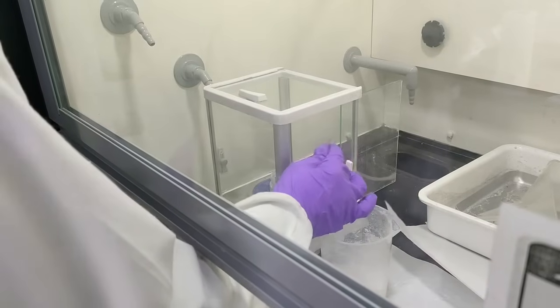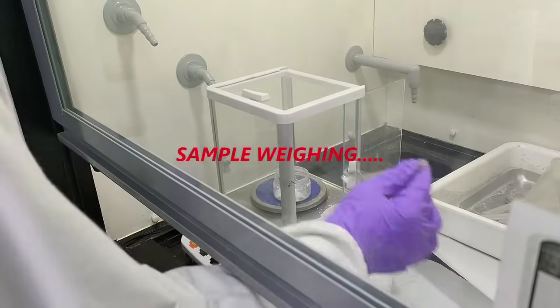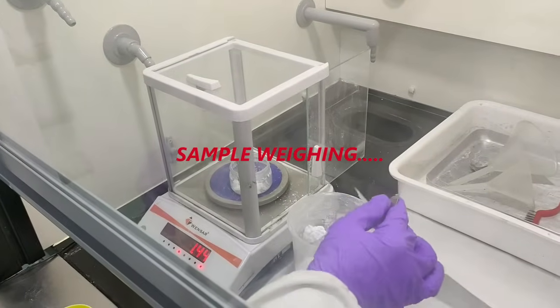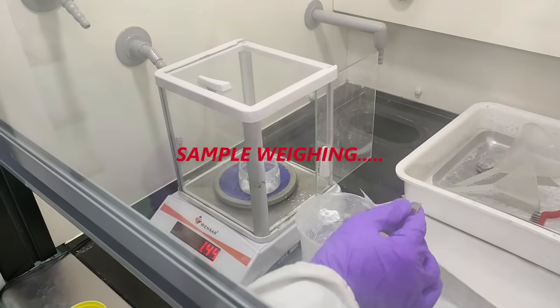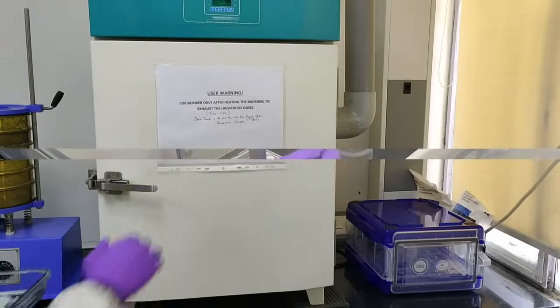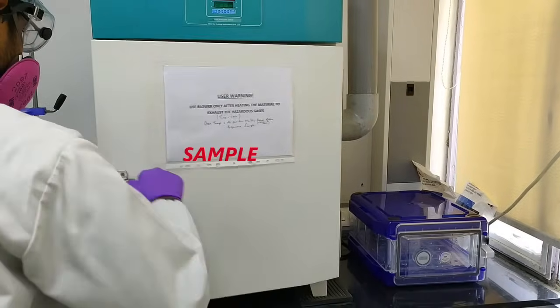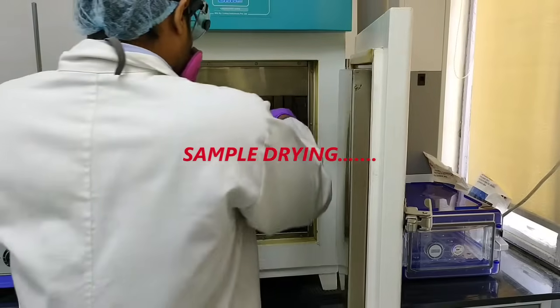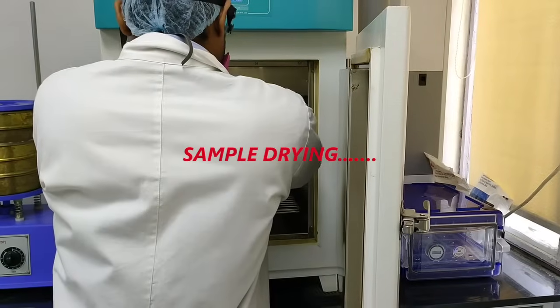Received materials from various clients are subjected to testing. We then assess and analyze the data generated and recommend the appropriate measures to mitigate the catastrophic events occurring at their respective sites.